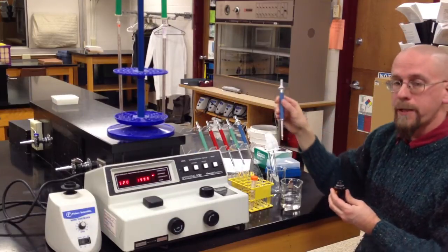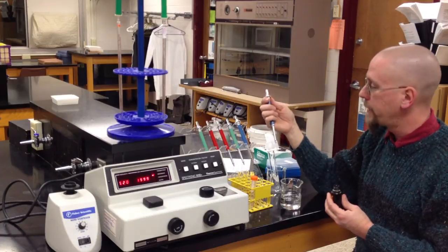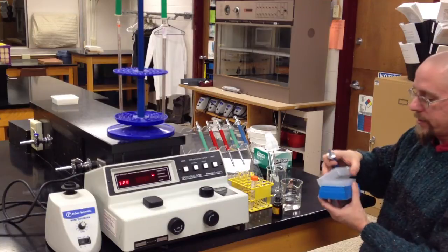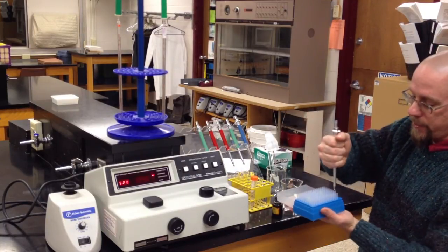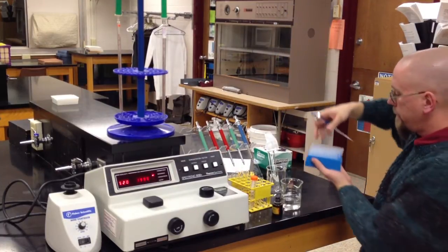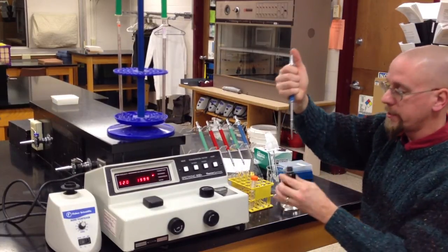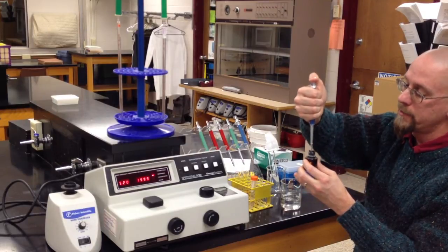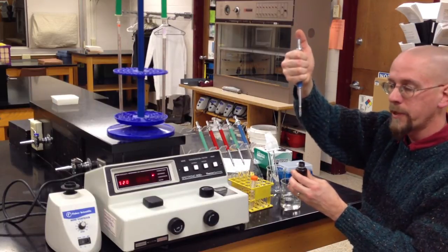So what we're going to use are micropipettes. You're going to have a rack of different volume micropipettes. The blue are 100 microliters. We have boxes here with pipette tips. You take these and you simply jam it down on and you now have a plastic micropipette tip on. What I'll do is stick the tip down into the iodine, depress the plunger slowly, let it out slowly, and now I have 100 microliters of iodine in my micropipette.